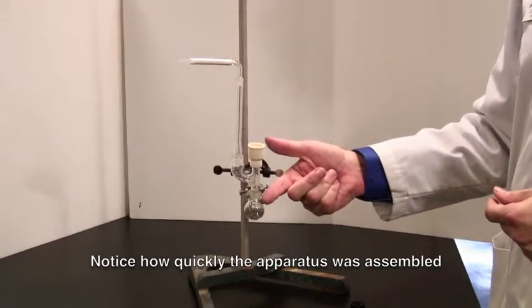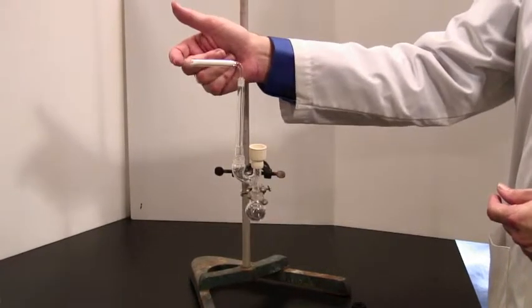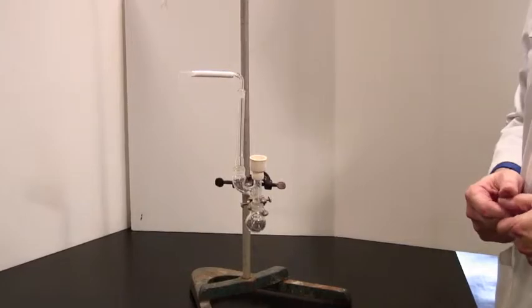This is now sealed off from the atmosphere, except for this entrance here, and moisture from the air will get stopped by the drying tube.